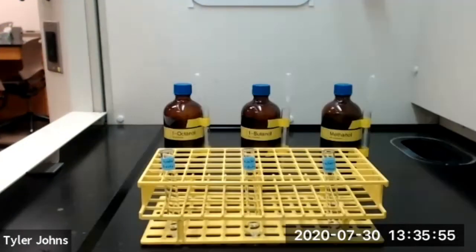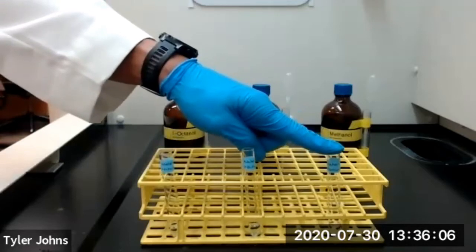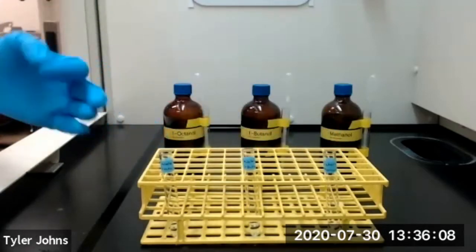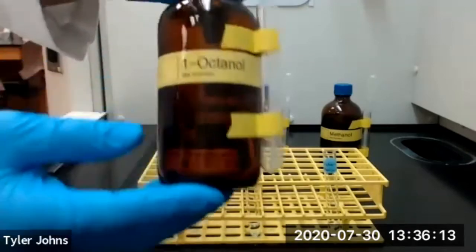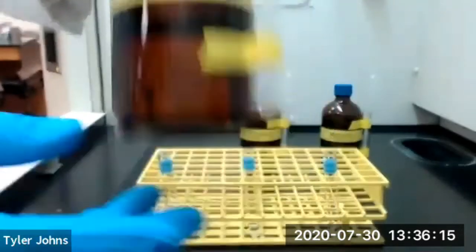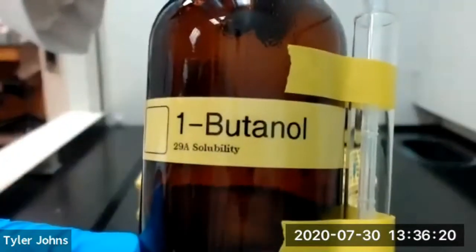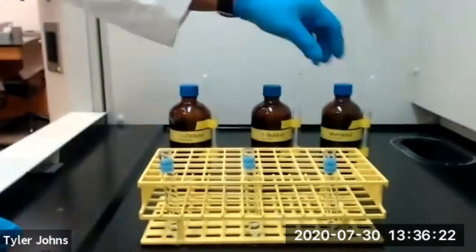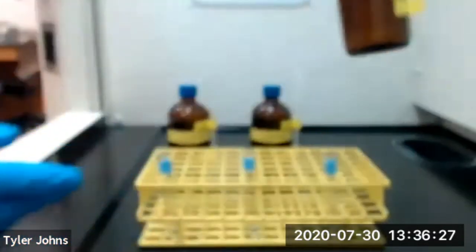In part B of this experiment, we're going to look at the solubility of different alcohols in water and hexane, and we're going to start with water. So I've already added 1 milliliter of water to 3 separate test tubes, and to each test tube, we're going to add dropwise a different alcohol. So we'll add 1 octanol to a test tube. We'll add 1 butanol to a test tube. And we'll add methanol dropwise to a test tube.